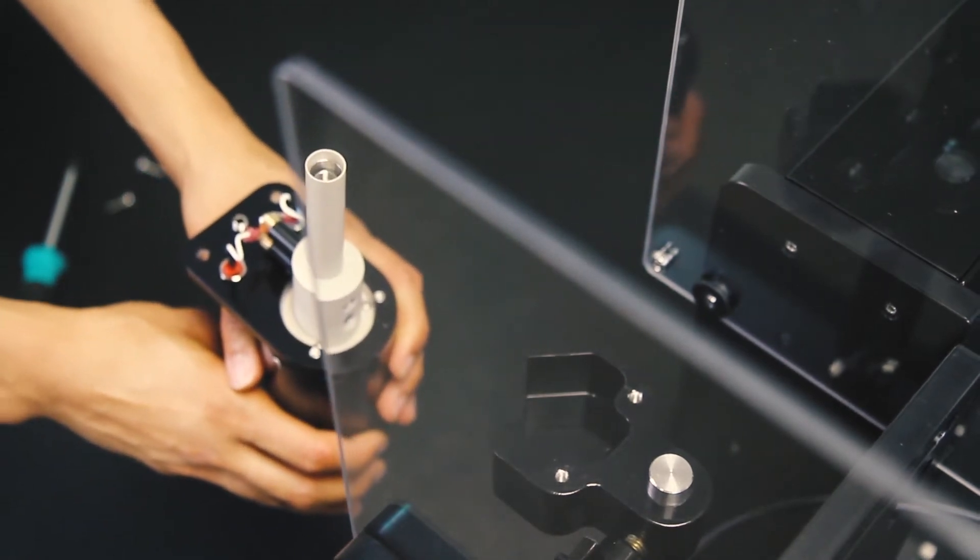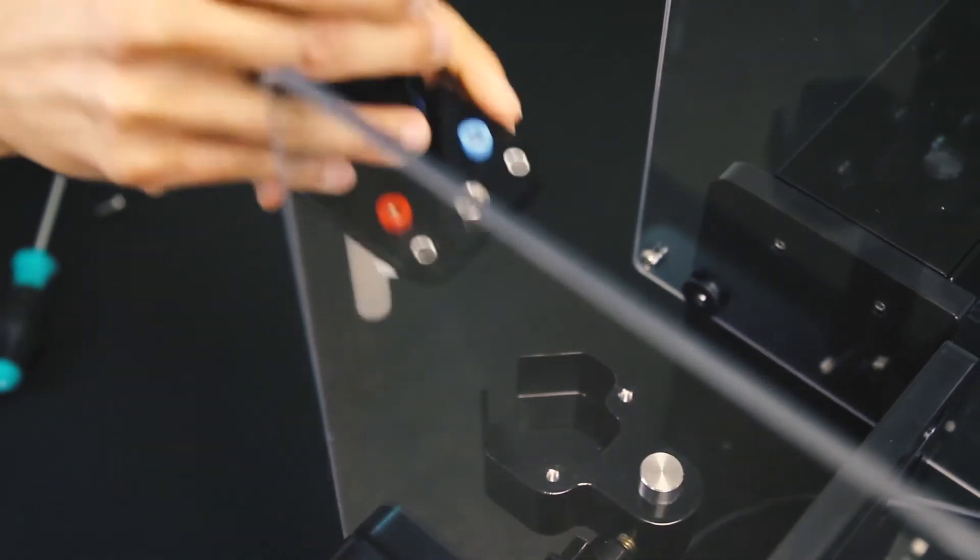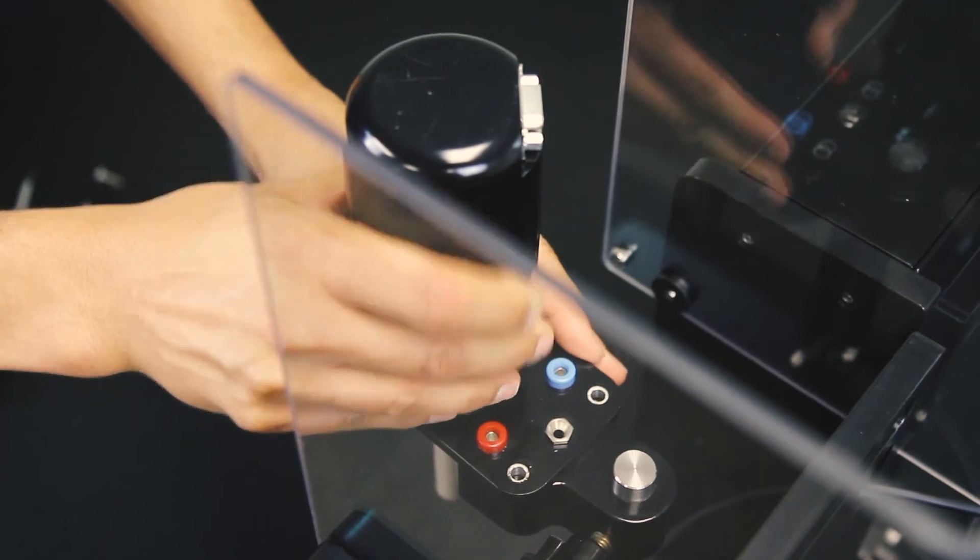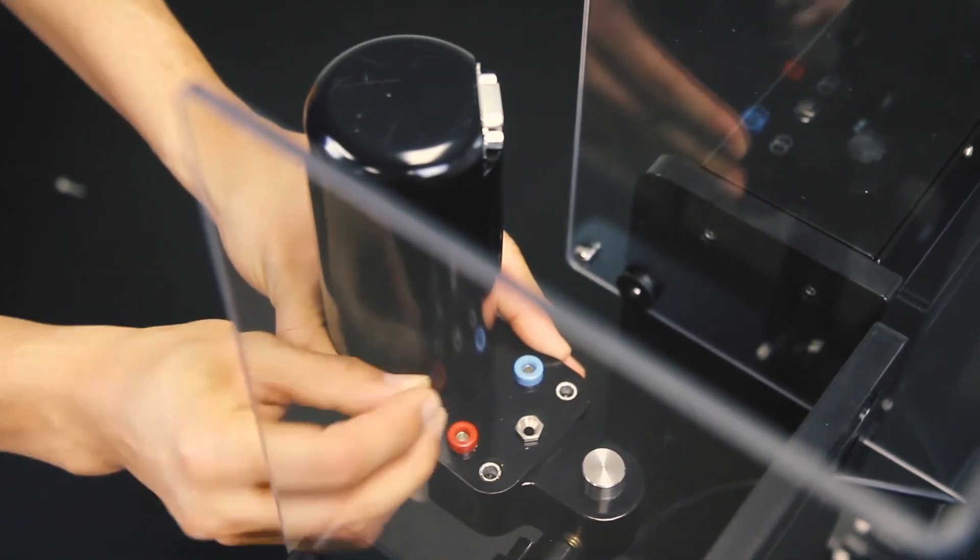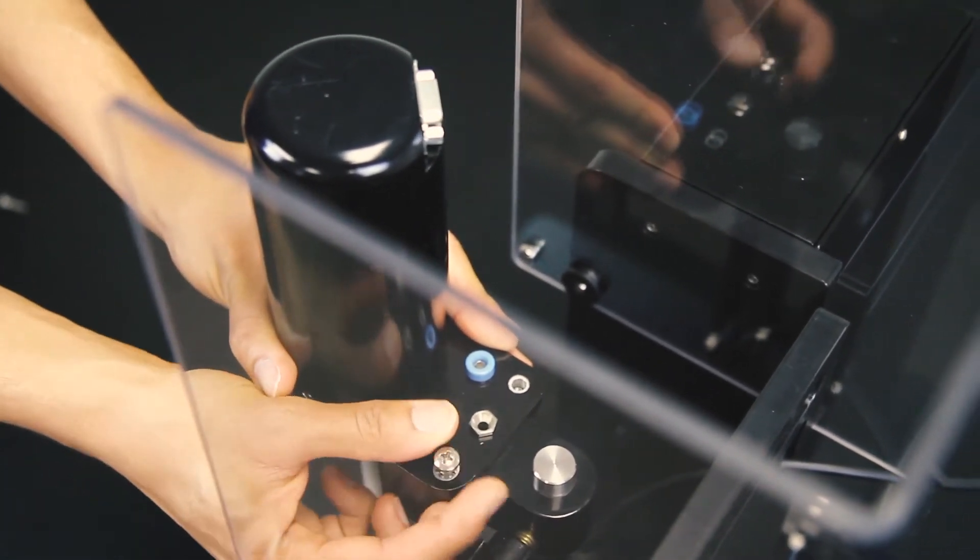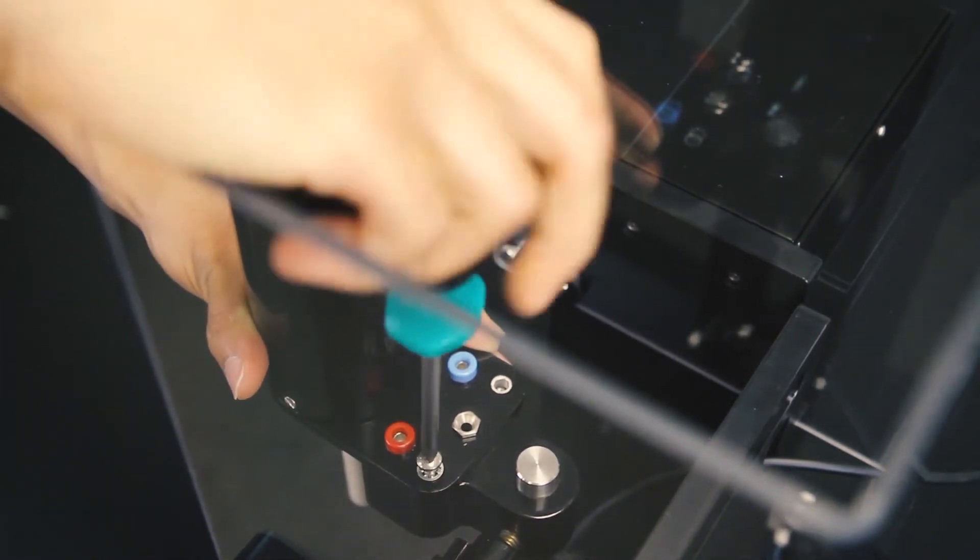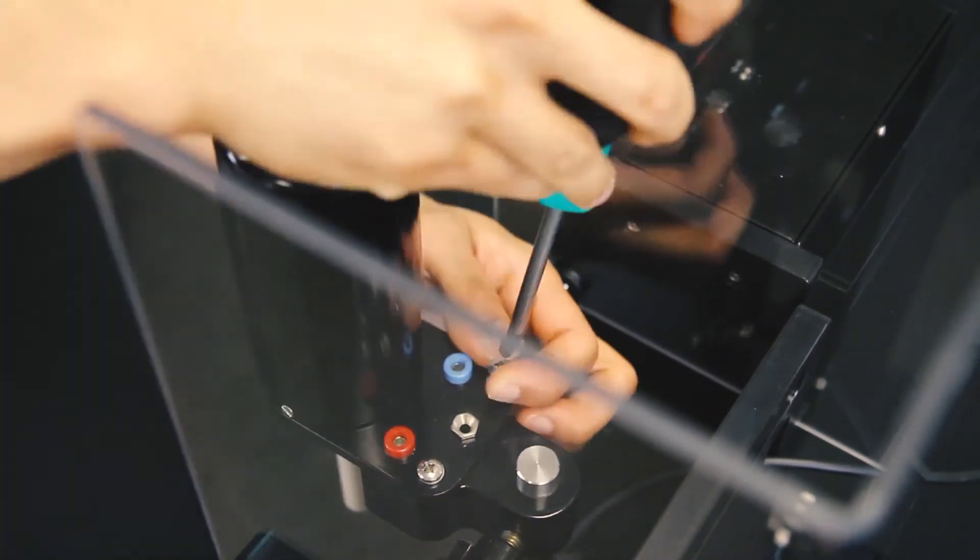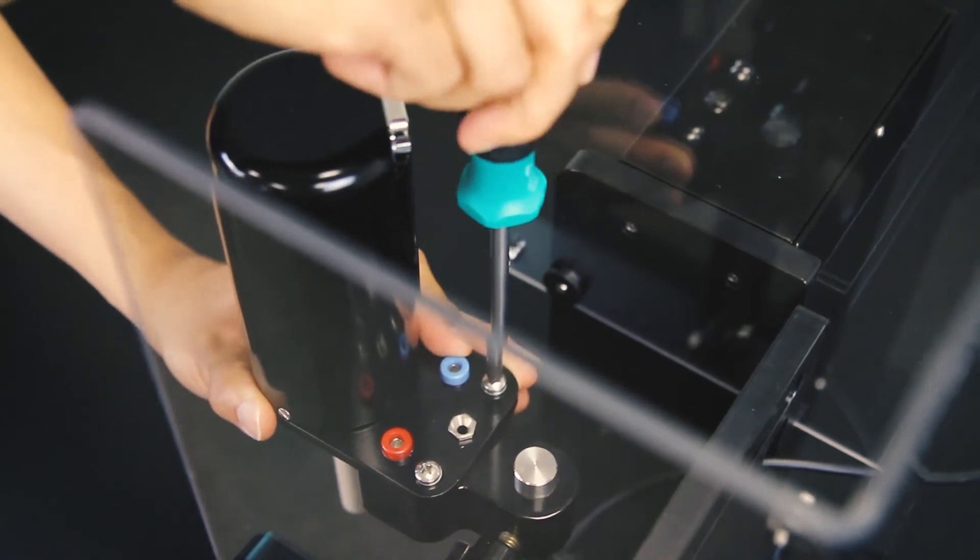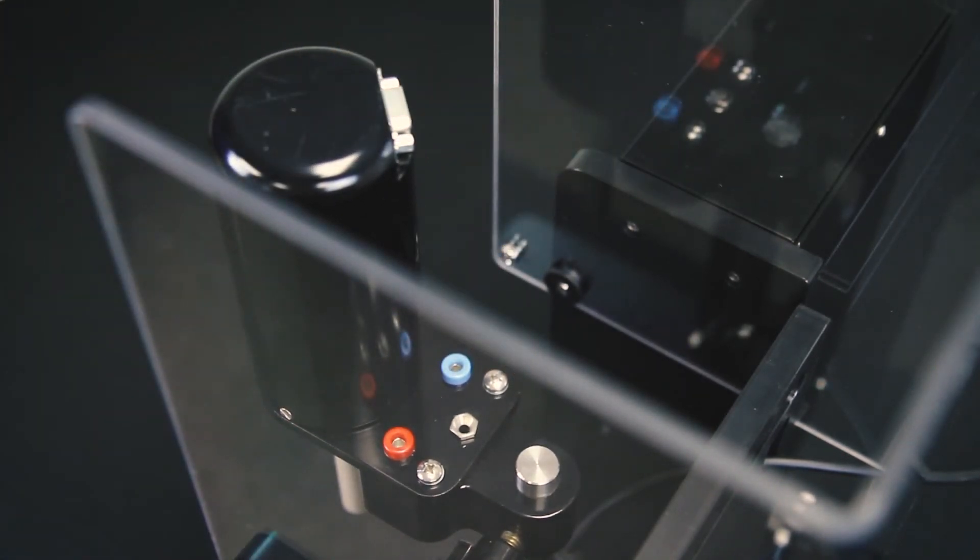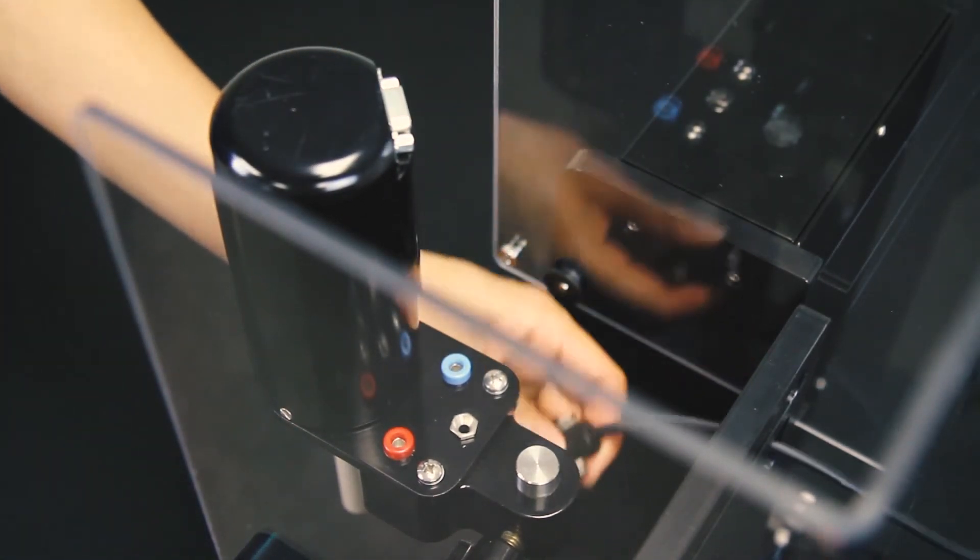Turn the motor unit right side up and place the motor unit back on the lift bracket. Install the motor unit by threading the motor bracket onto the lift bracket. Reconnect the motor cable and tighten the two thumb screws with your fingers.